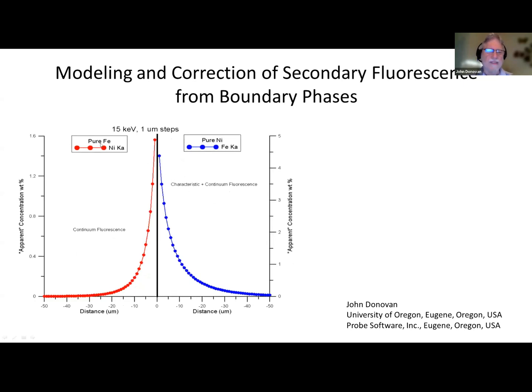This is not the worst case example in the periodic table, but it's a bad one. Castaing actually talked about the worst one. We have a sample of pure nickel and a sample of pure iron, and we're measuring nickel in pure iron, and iron in pure nickel. The boundary is right here in the middle. Here's our pure iron measuring nickel, and pure nickel measuring iron. Here's our boundary, and this is the distance away from the boundary.